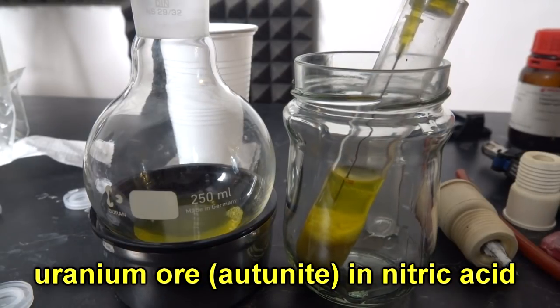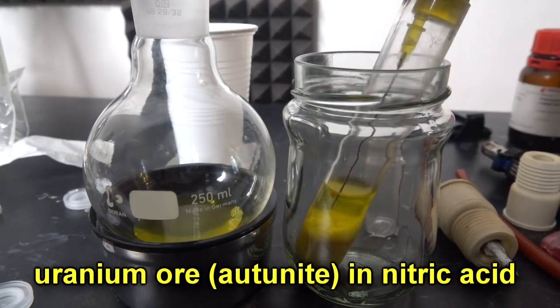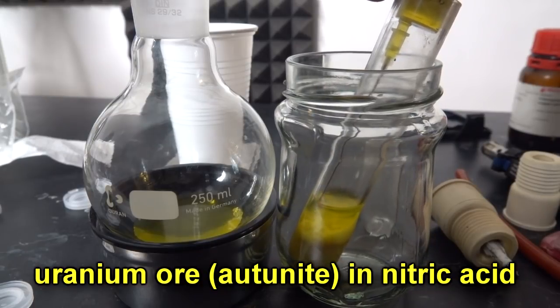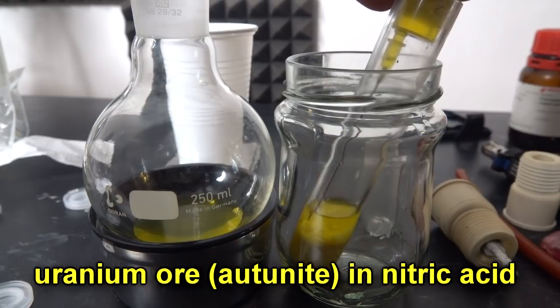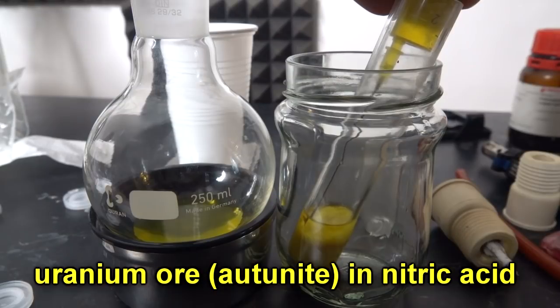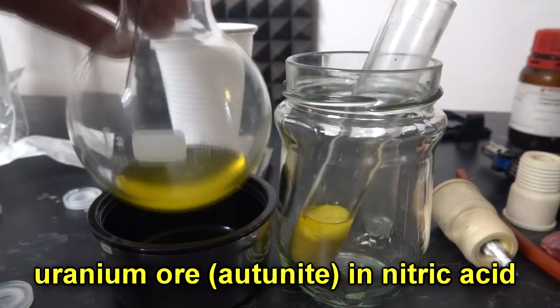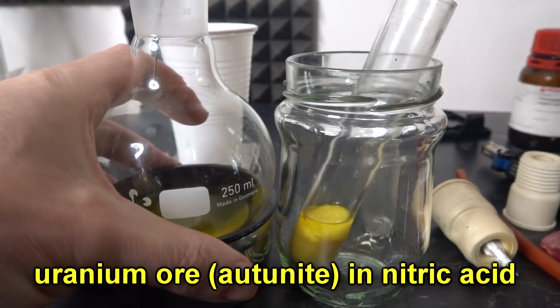It's uranium, it's got a half-life of four and a half billion years, which in practice means not so radioactive. For certain, the thing that I'm most worried about here is getting the nitric acid on my skin, which is why I'm taking some degree of care here.